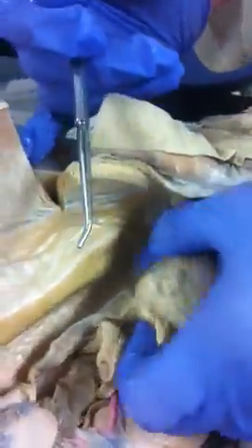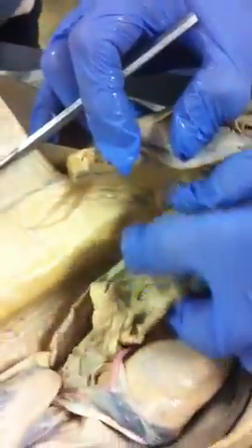Moving down into the abdomen — this is a large pregnant shark. The yolk sac is here; there is a small embryo, or should be a small embryo, attached to that. We'll bring the embryos out in a couple minutes.